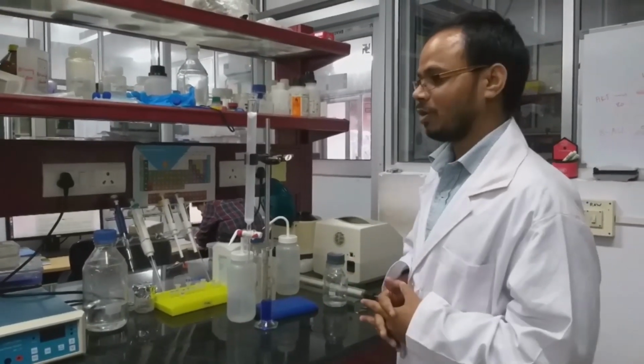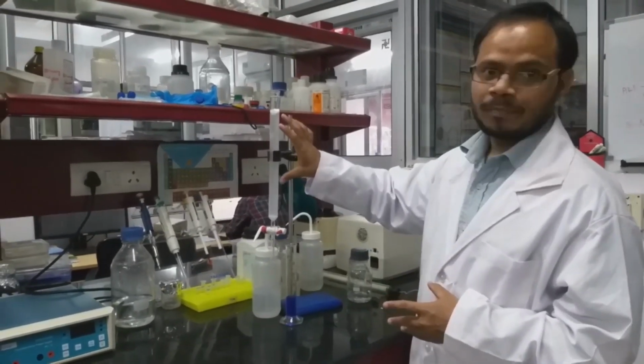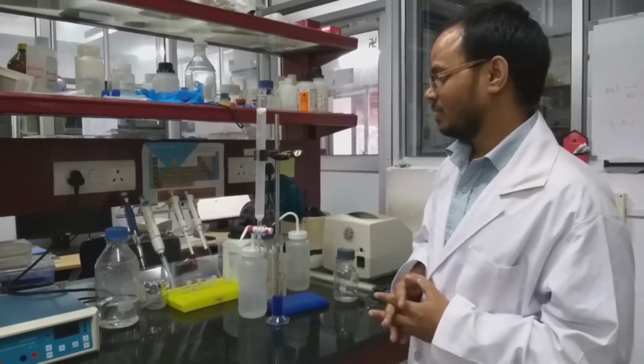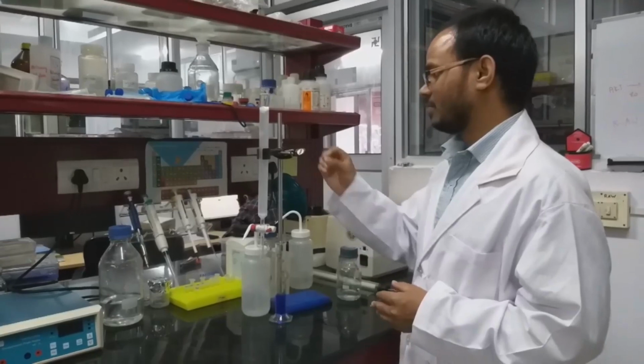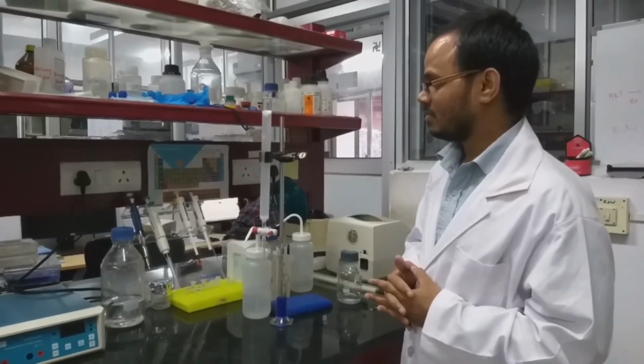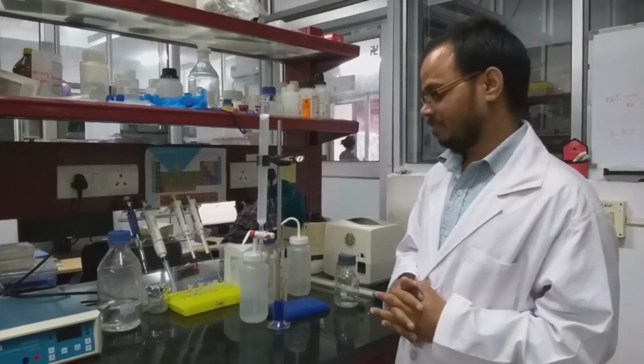Now what about total volume? Total volume consists of the packed volume of the beads. It is around 25 ml of beads, so that means the total volume is 25 ml.